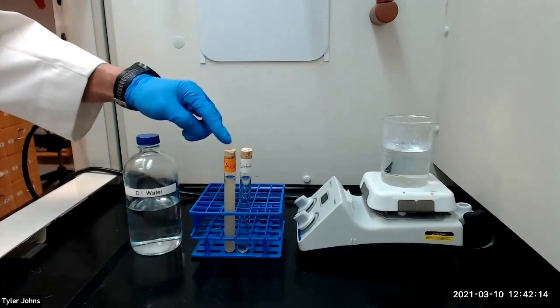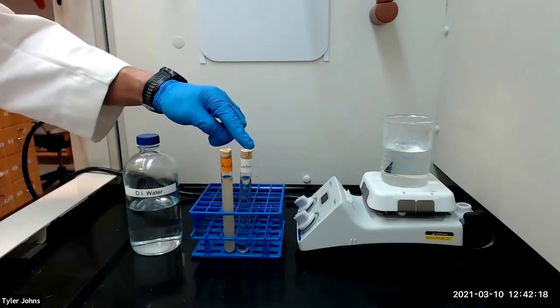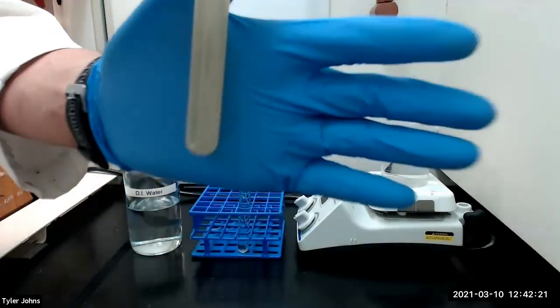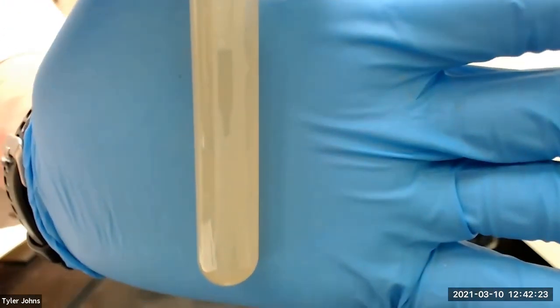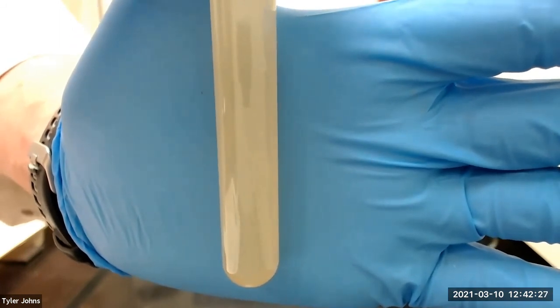After 15 minutes, this is what our test tube with the acetone looks like and what our negative control looks like. The appearance of a pale yellow precipitant of iodoform that will slowly settle to the bottom of the test tube indicates a positive test.